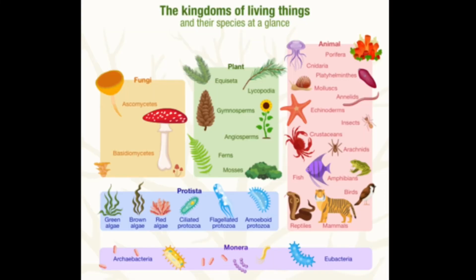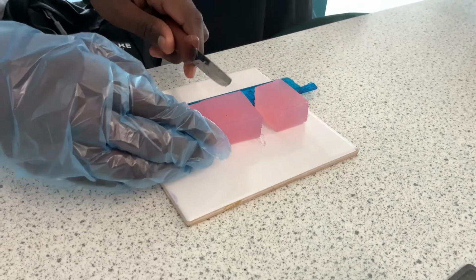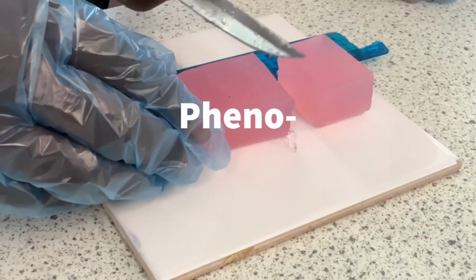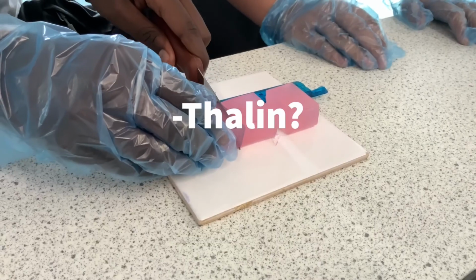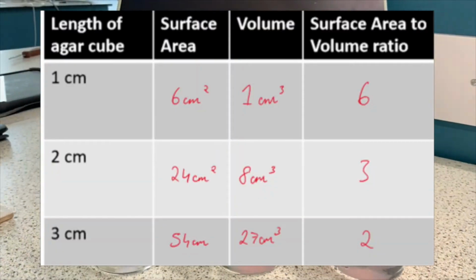Surface area to volume ratio is extremely crucial to any living organism since it can help to speed up the process of diffusion. Here's a practical we did to demonstrate this. In this practical, a chunk of set phenolphthalein, try saying that 10 times fast, was cut into 1 centimeter, 2 centimeter, and 3 centimeter chunks, and their surface area and volumes were recorded.